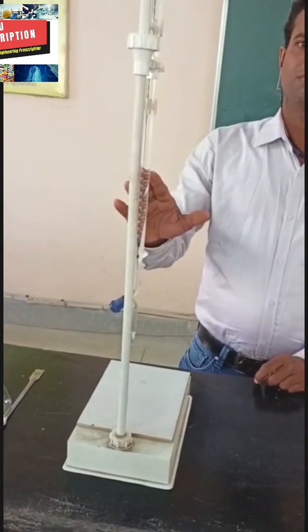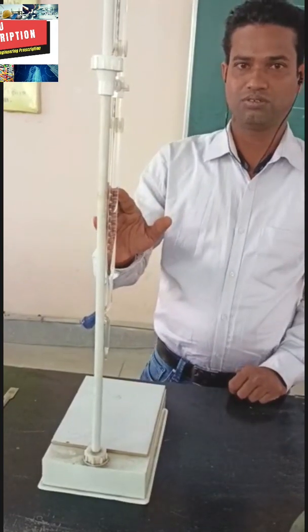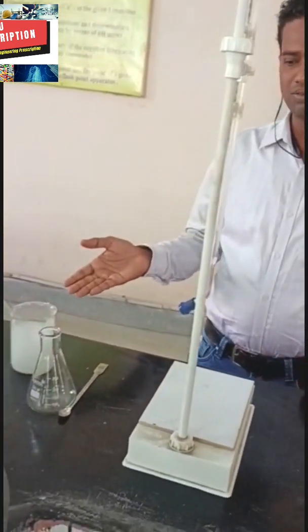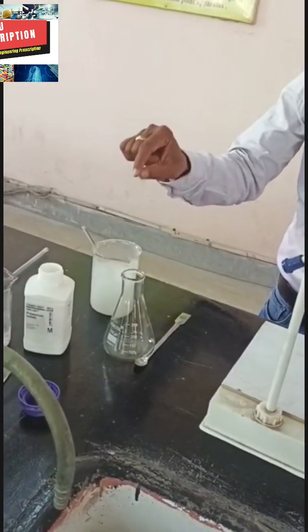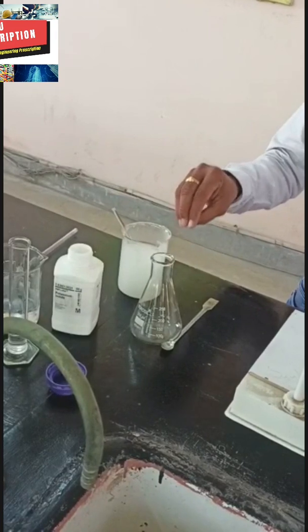After preparing the bleaching powder solution, we fill the burette with N/100 hypo solution. Then you pipette out the bleaching powder solution into a conical flask, then add one gram solid KI followed by 10 ml acetic acid. After addition of these two chemicals, iodine is liberated.